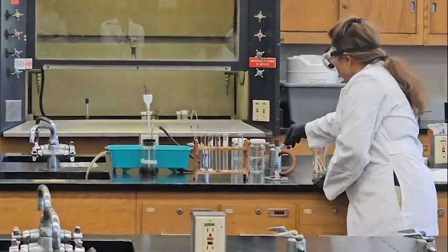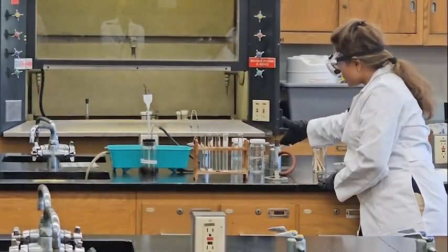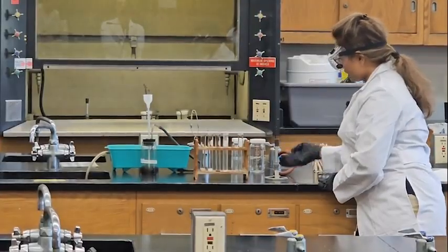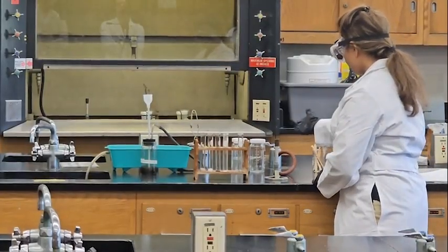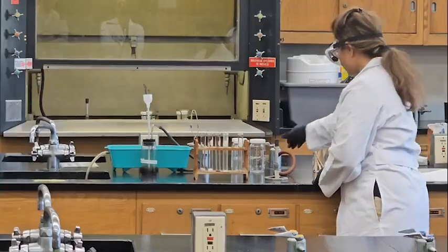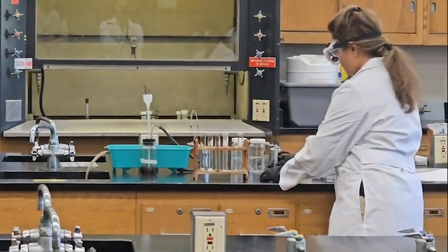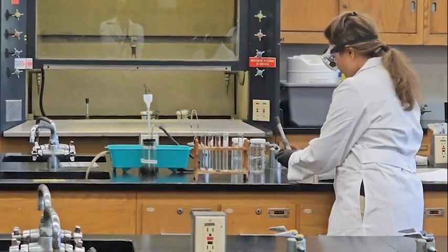Here you can see this part closes the gas. With the valve vertical, all the way down here, the gas is coming up. Horizontal means there is no gas, the valve is closed. Now I'm opening my gas. This one I closed already. I need a little bit of gas so that I can turn it on.